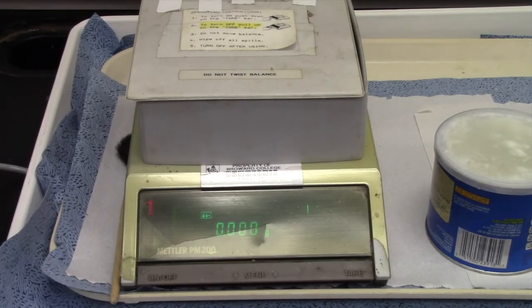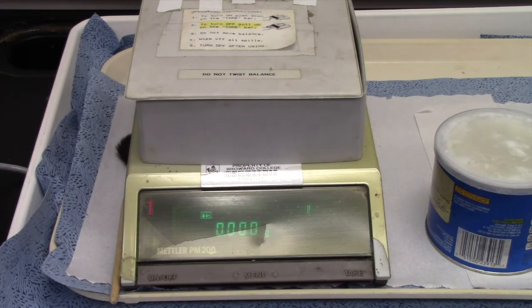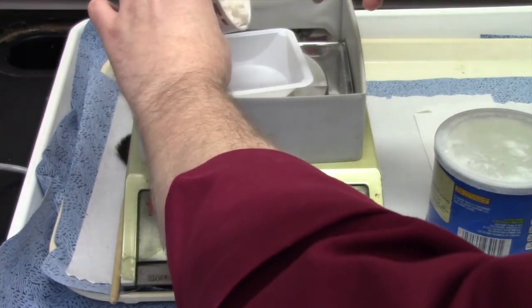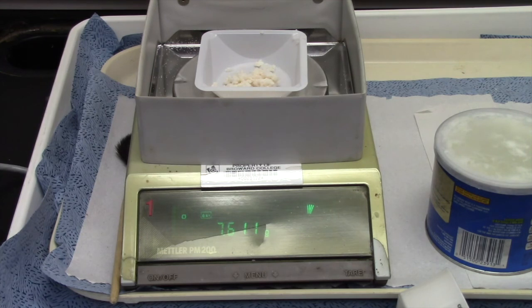Okay, so now it's time to weigh our soap. I'm going to take a weighing boat, place it on top of the pan, and then re-zero. Now I'm going to use a laboratory spoon and transfer my soap as best I can onto the weighing boat. And I got 7.611 grams of soap. Don't forget, this is wet, so I'm weighing the mass of a lot of water too. There's the mass of our soap.